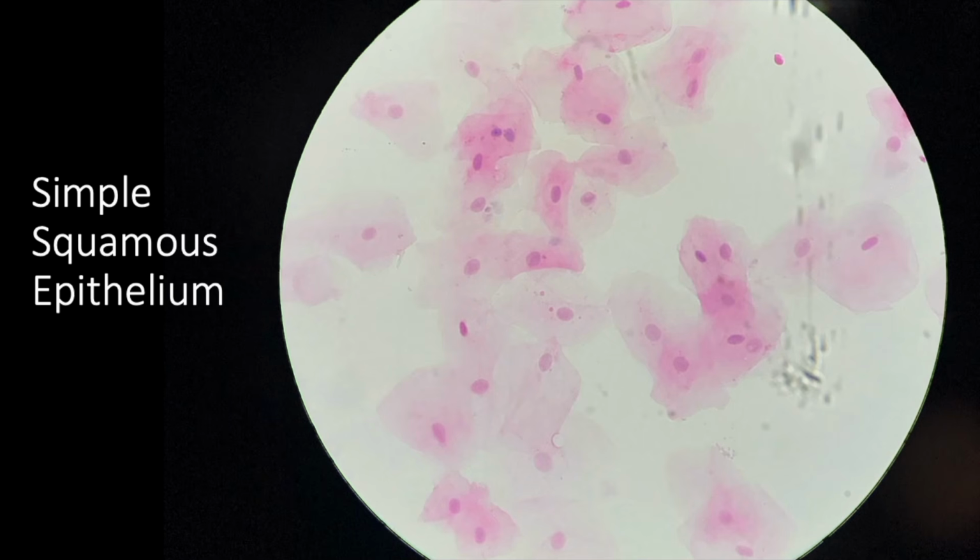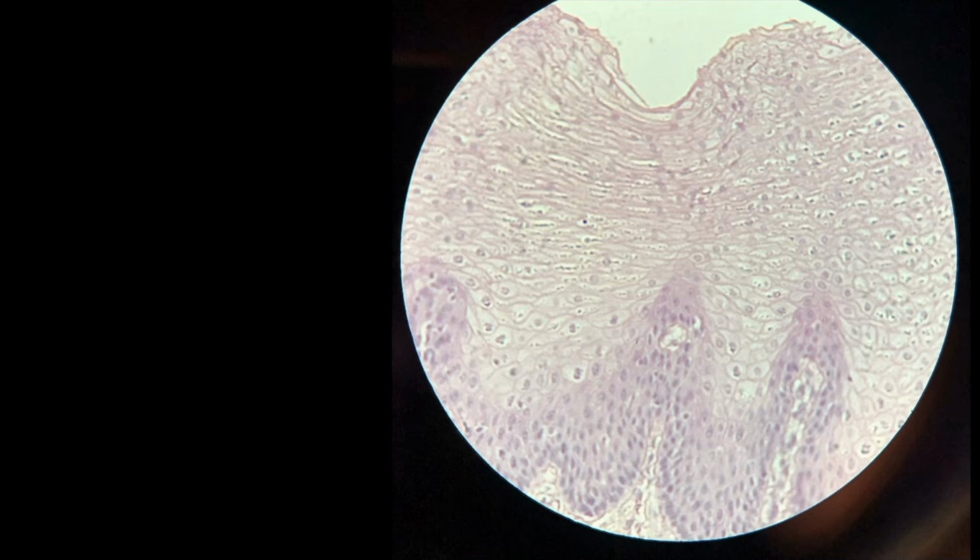So this is simple squamous epithelium. All right, here's our next tissue. Notice how many layers. I mean, look at this. Now, this is a cross section. Look at all the layers. You can see these cells. They're sort of parallel to the ground. They're flat. They may not be so flat as they go down like this, but they are very, very long and slender. Lots and lots and lots.